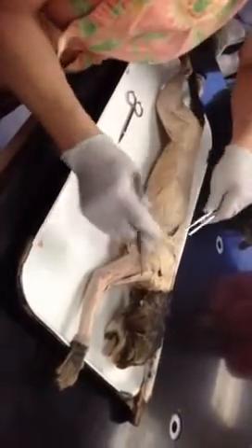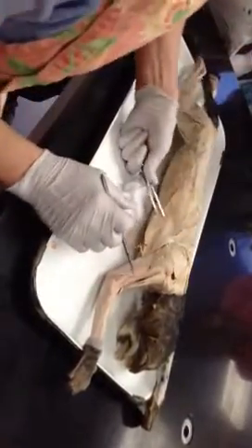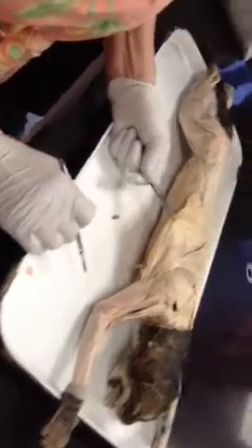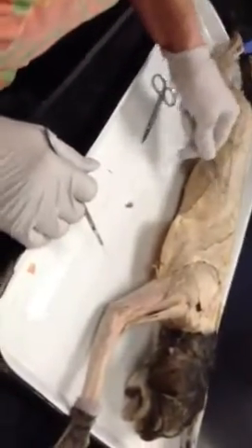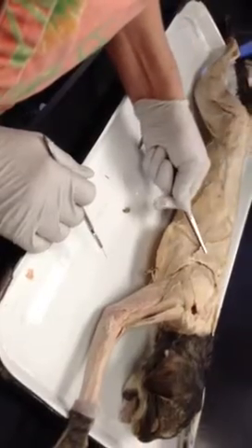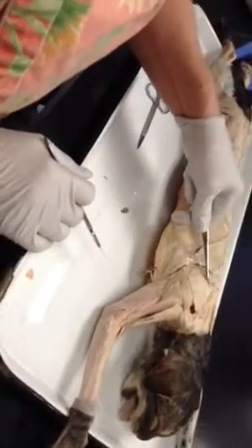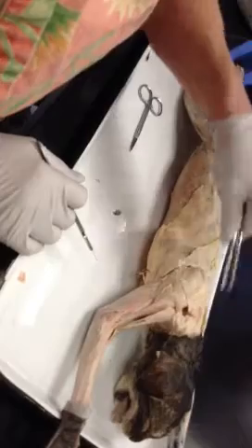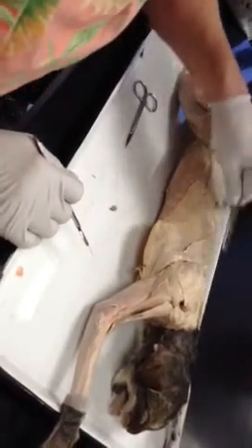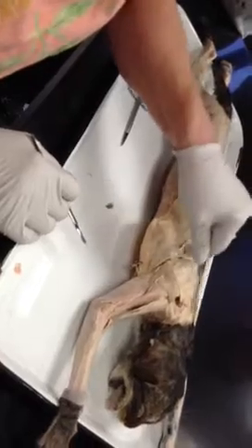Is that one the spinal trapezius? Yep. Here is latissimus dorsi. You got it. Okay. We got two. Lying on top of that is your spinal trap. This is your acromio trap, and this is your clavotrapezius. So spinal, acromio, clavo.